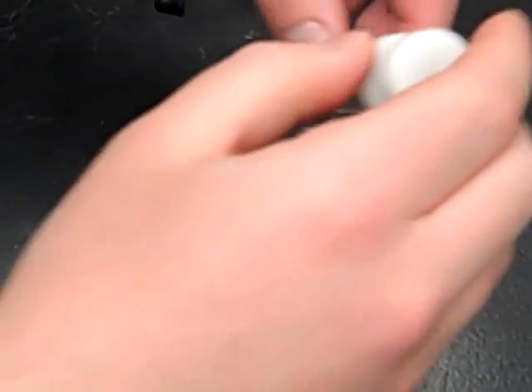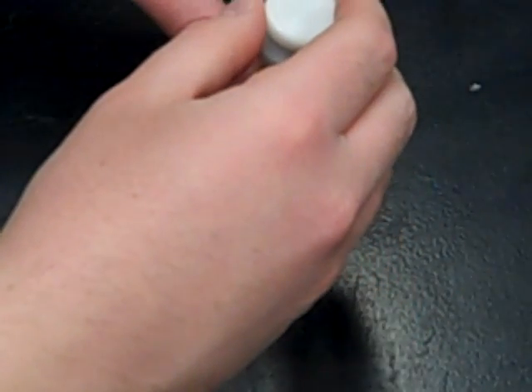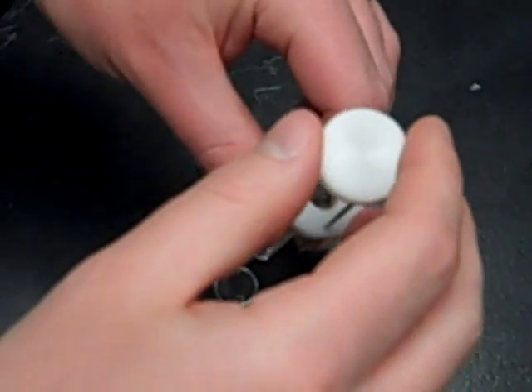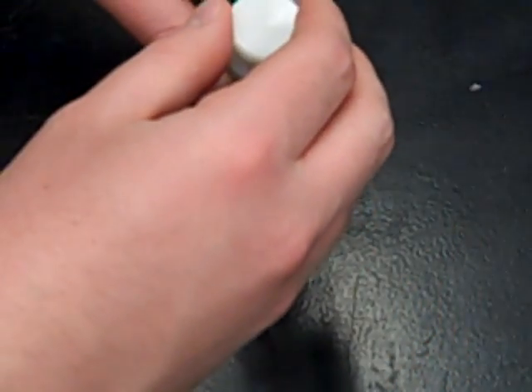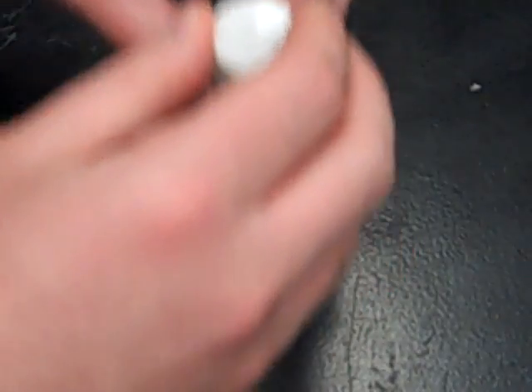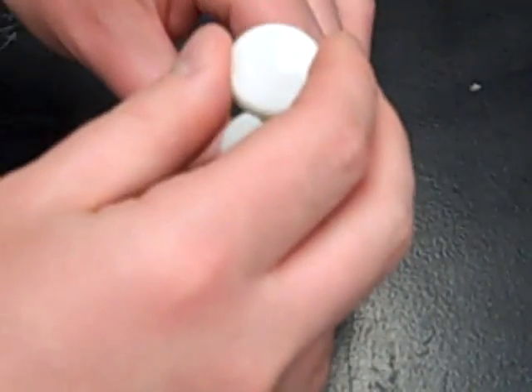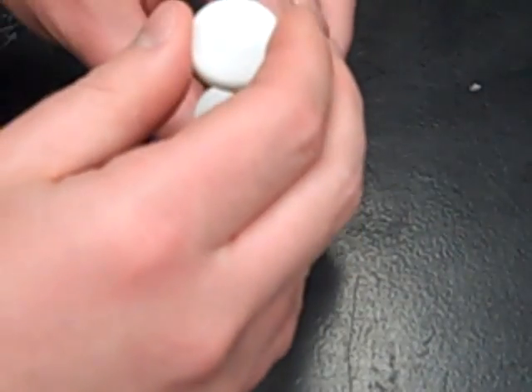While your run is working, you might want to rinse your needle because you don't want the next person in line to have your product in there. So you're going to take up some of that wash acetone probably five times and clean out your needle so that the next person in line has a clean needle to work with.